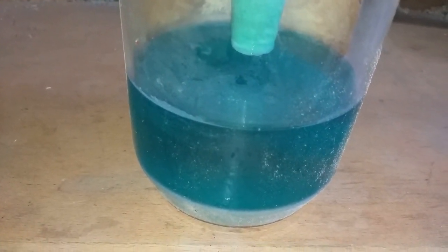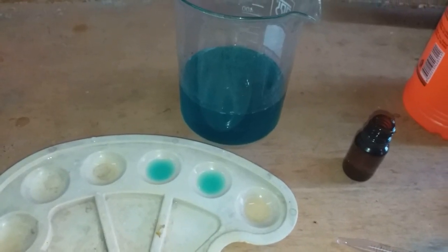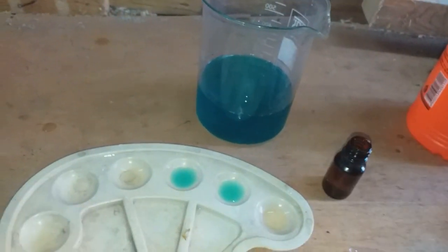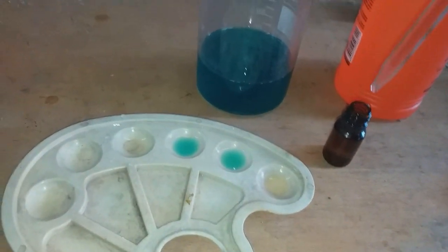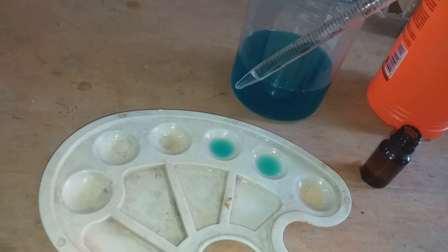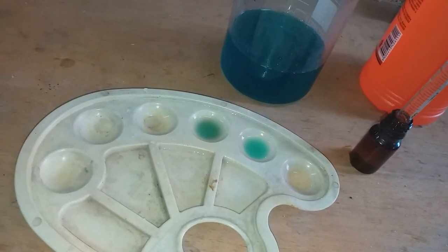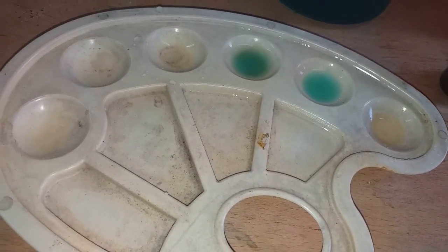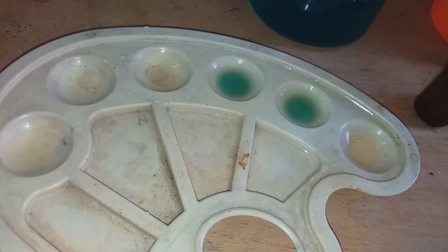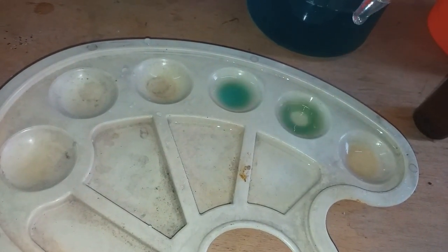I will test that for silver and palladium. In this beaker I got the solution, very clear. Here I got a sample for my Stannous test with some hydrochloric acid. Let's see - is there any palladium in solution? There is a very, very small reaction, but this reaction goes green, not black. So this is not palladium - this kind of capacitor does not contain any palladium. For palladium, this capacitor is worthless.